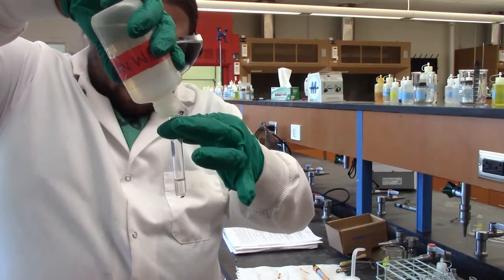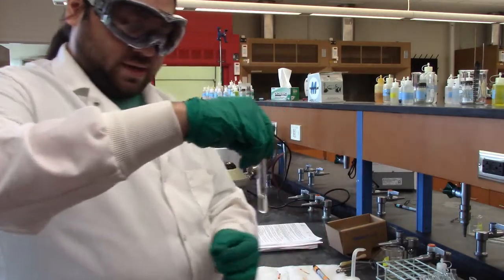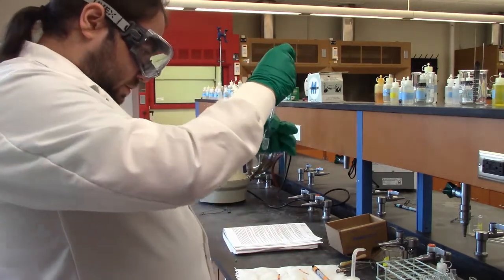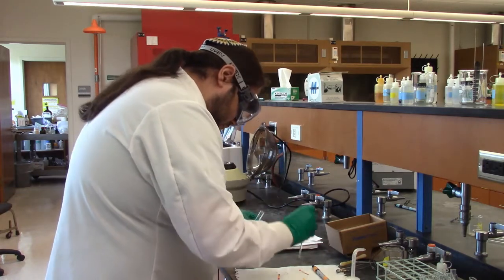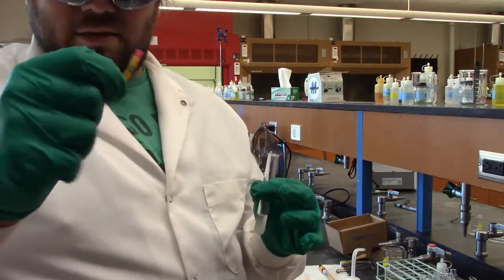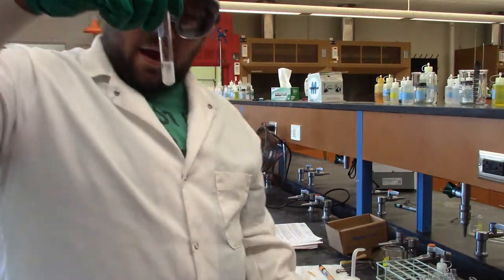There isn't a major change like with the HCl earlier, so I put some drops in there and it's fairly concentrated. So I'll give it a swirl, and I'll touch it to the pH paper. We'll see what happens. It came off kind of green, so we're just slightly basic. But I'm getting the thumbs up from Professor French behind the camera, so that'll still work. And also, if you look closely, you can actually see some stuff starting to precipitate out of there.